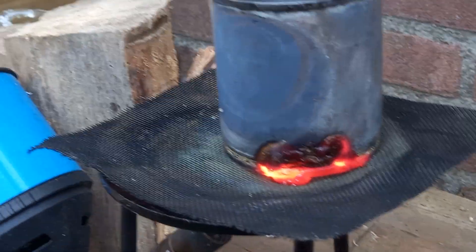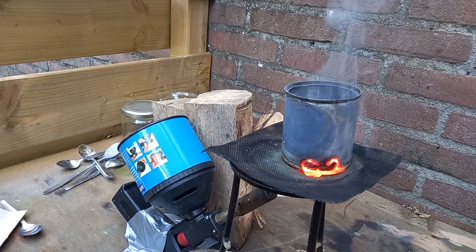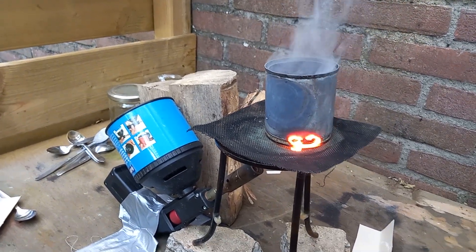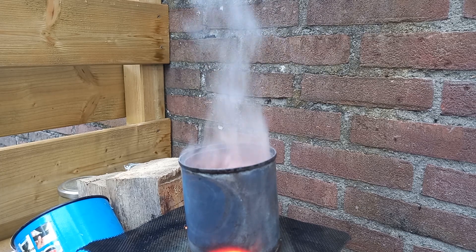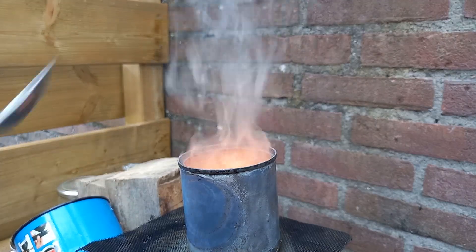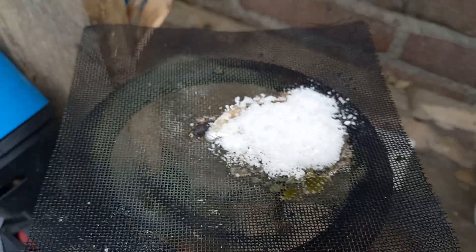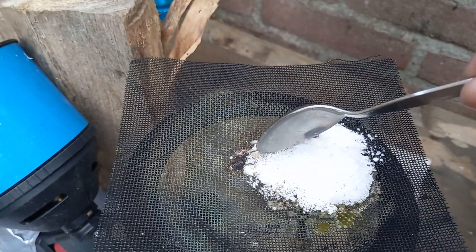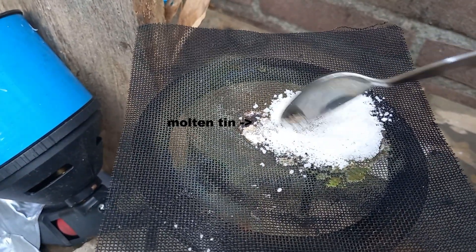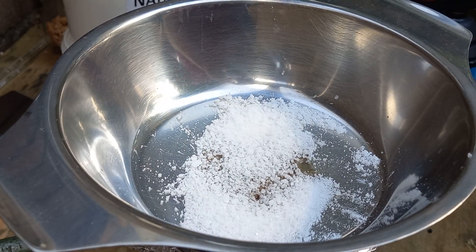I searched around the house for a new crucible and I thought I found a perfect one — it was thick cast iron, looked kind of perfect for what I was planning to do. But I heated it up and it immediately melted like in two seconds, it was just a puddle. Apparently it was just black painted tin. So yeah, look at this. I just got one of these metal things for like a dollar — that worked much better.